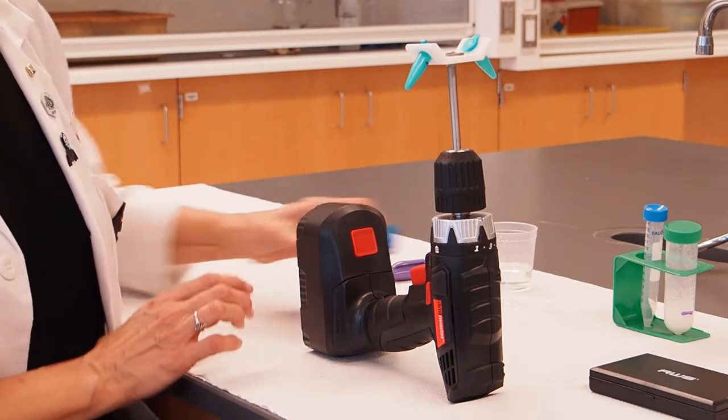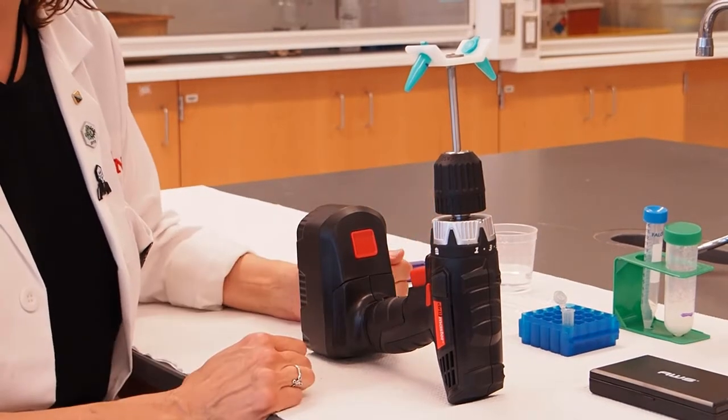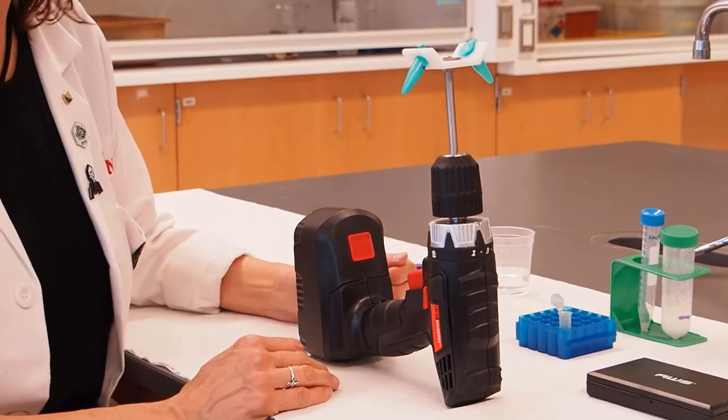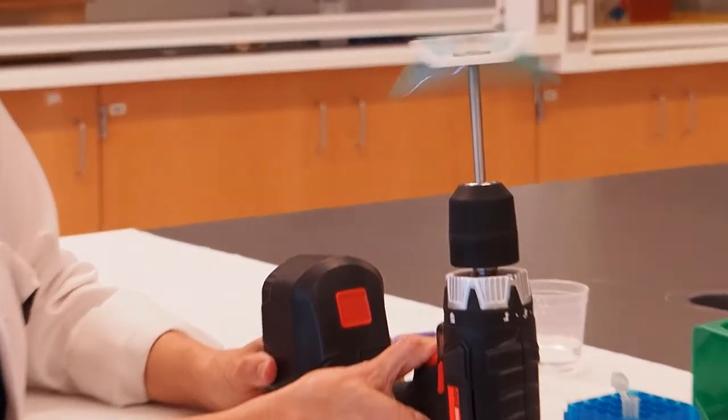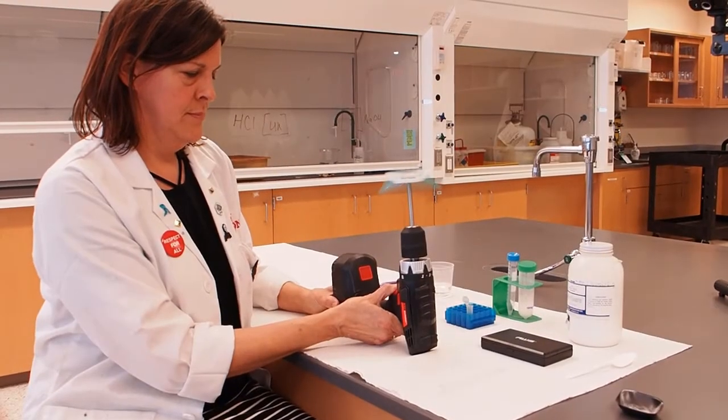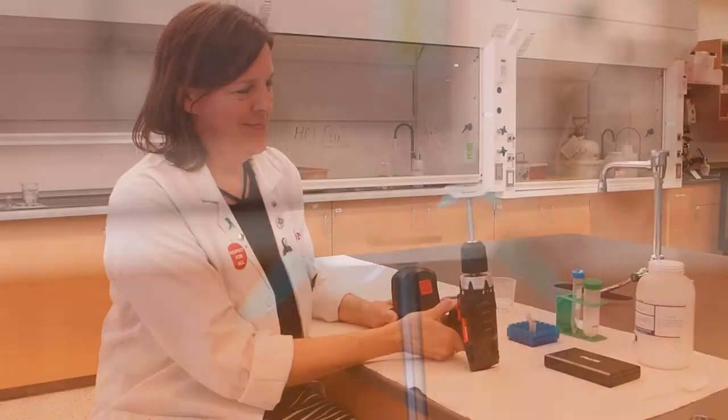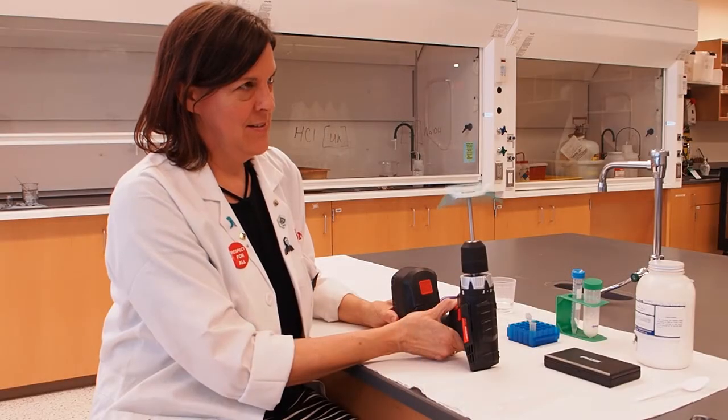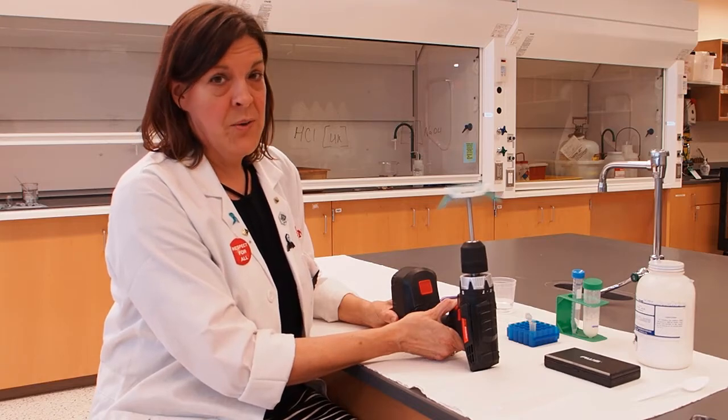The next thing we're going to do is spin our samples by turning our centrifuge on. We're just going to spin them for one minute.